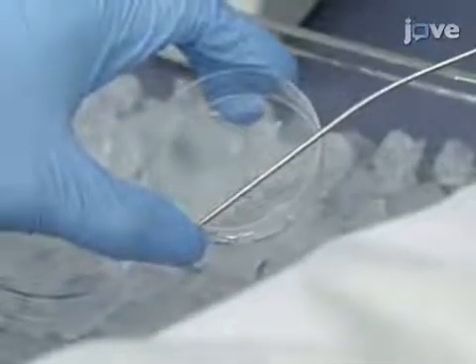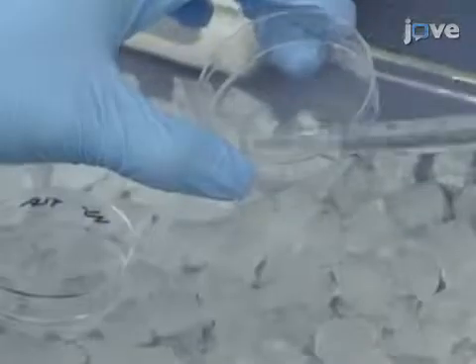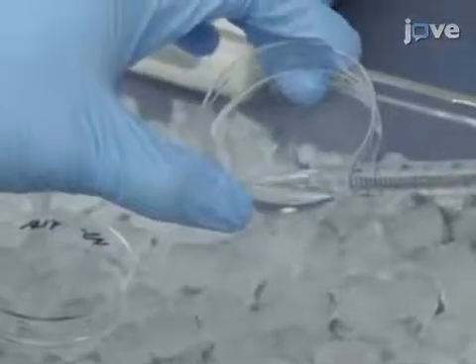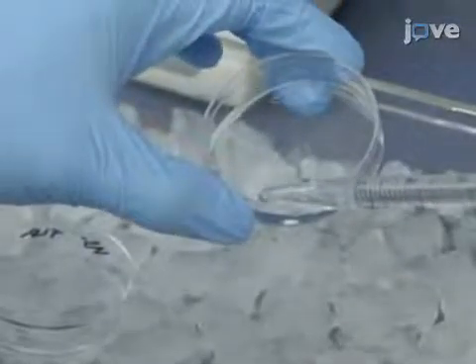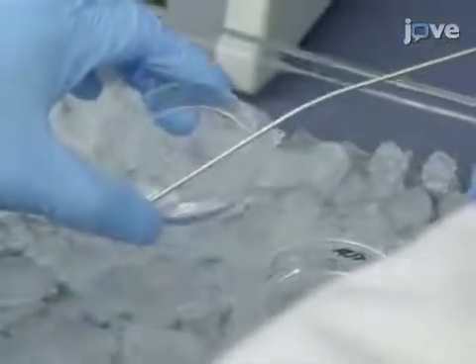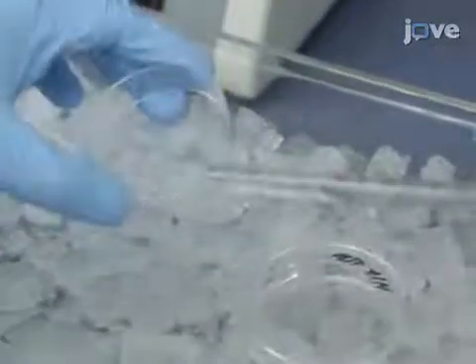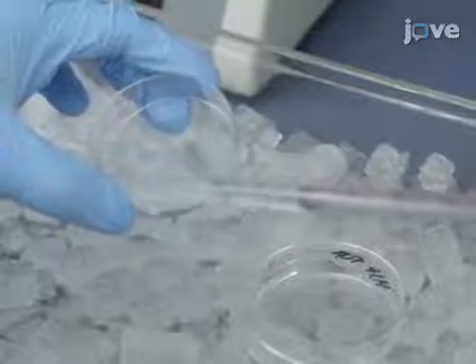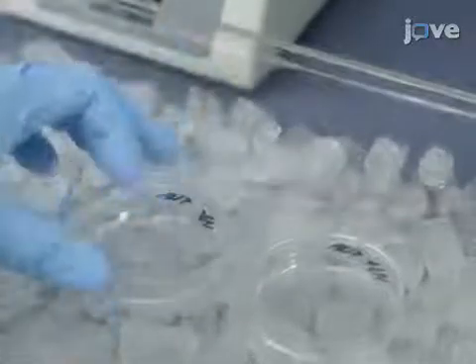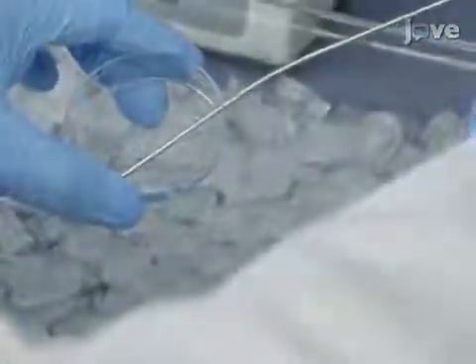Afterward, remove the biotin buffer and replace it with 4 mL of quenching buffer, keeping the cultures on ice for 10 minutes. Next, aspirate and replace with the same amount of quenching buffer, leaving the cultures on ice for another 10 minutes. Then discard the quenching buffer and wash the cells thrice with 4 mL of chilled CMPBS.